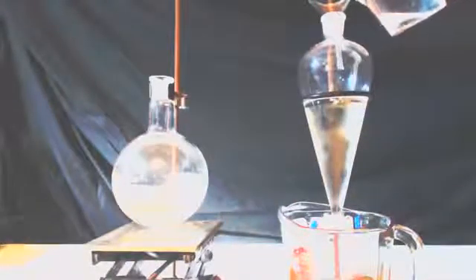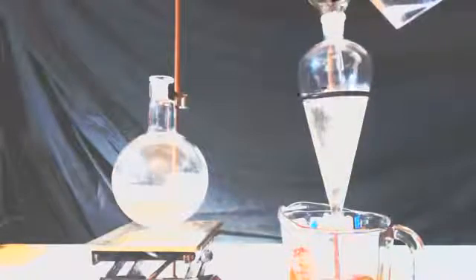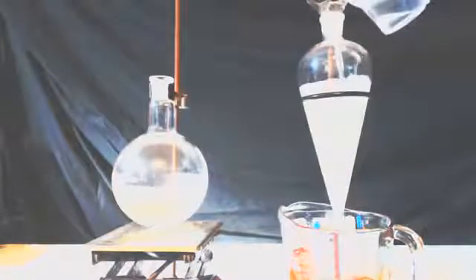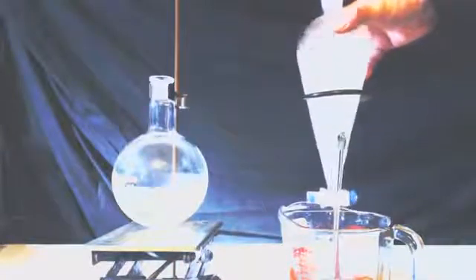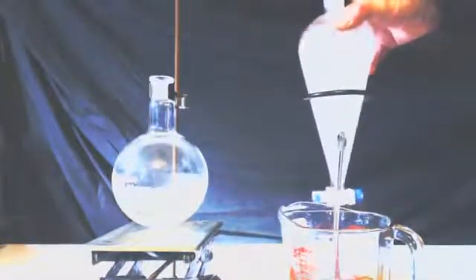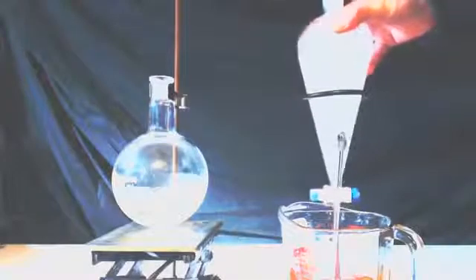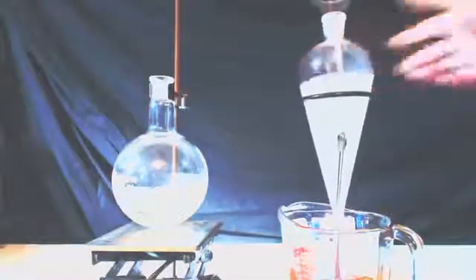You'll notice that I only have a separatory funnel that's big enough for half of what was in the can, so to the left is half of what's in the can, and to the right I'm putting half of the can in this separatory funnel, and I'm now pouring water in there. Shaking it up, and then all the acetone should, or most of the acetone should, go to the water layer, and then the top layer would be just the hydrocarbons including the toluene.